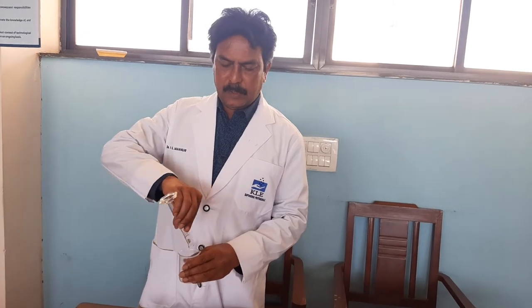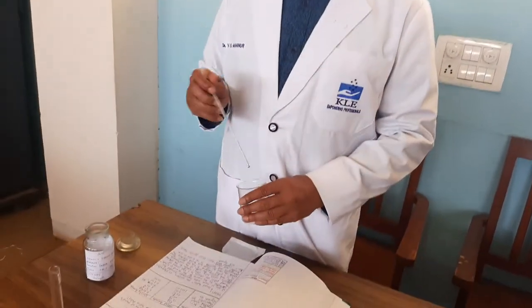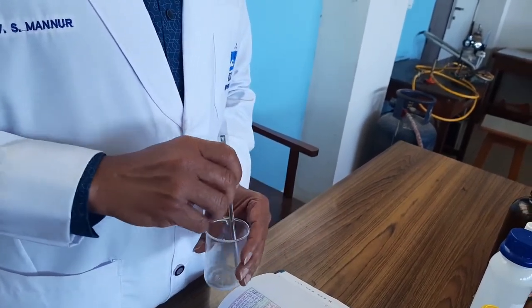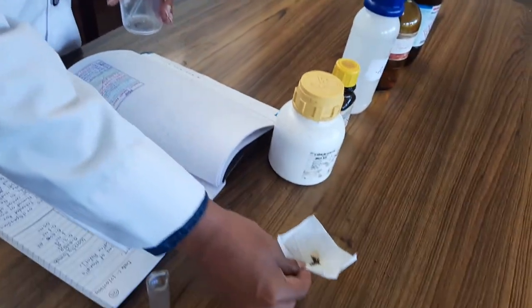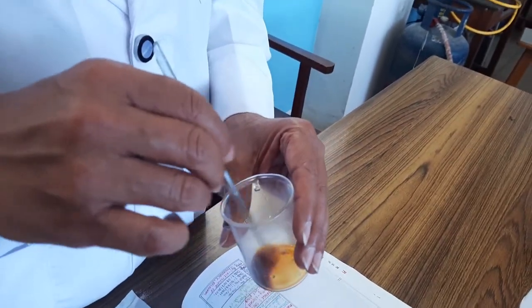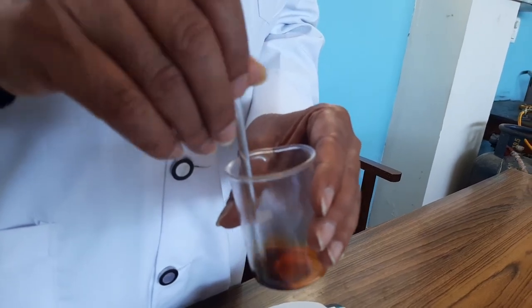In a beaker, add potassium iodide and dissolve it in water. Once potassium iodide is completely dissolved, add iodine little by little — or we can add all at once because iodine is highly soluble in the presence of potassium iodide. See to it that all the iodine is completely dissolved in the solution of potassium iodide.